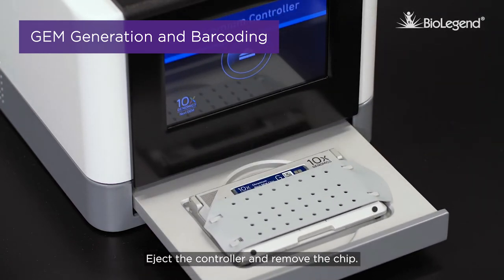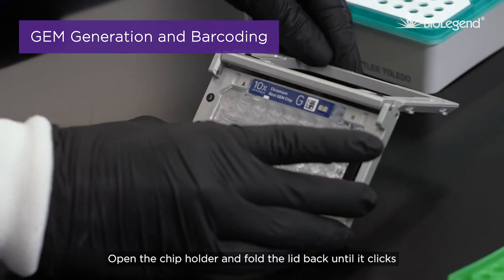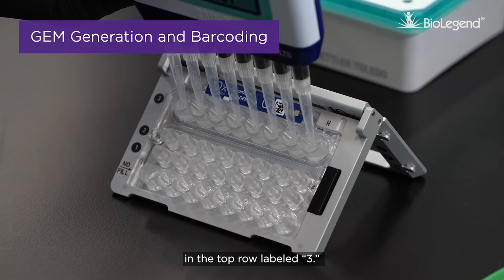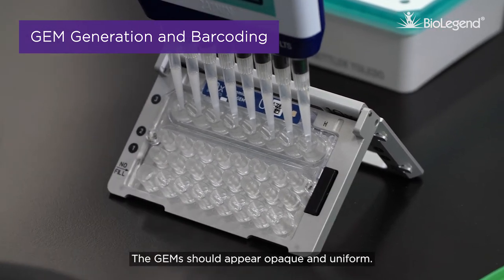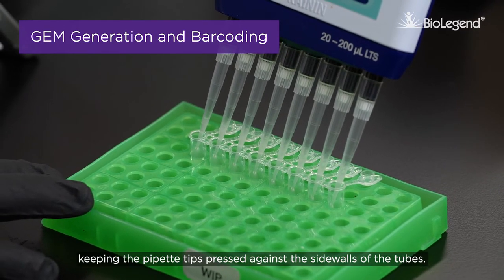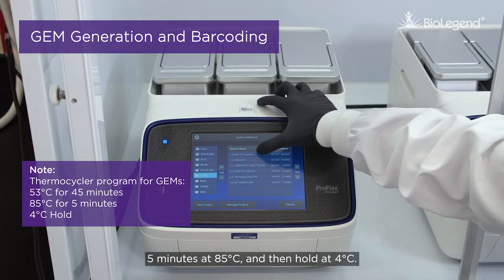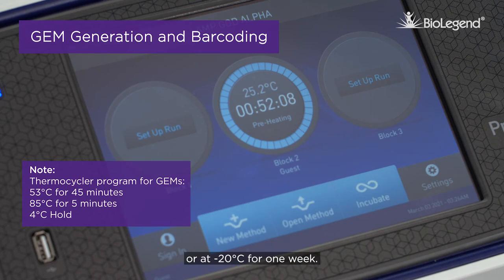Eject the controller and remove the chip. Discard the gasket. Open the chip holder and fold the lid back until it clicks to expose the wells at 45 degrees. Slowly aspirate 100 microliters of GEMs from the lower points of recovery wells in the top row labeled 3, without creating a seal between the tip and the bottom of the well. Withdraw the tip from the well — the GEMs should appear opaque and uniform. Over the next 20 seconds, dispense the GEMs into a tube strip, keeping the pipette tips pressed against the side walls of the tubes. Incubate the GEMs in a thermal cycler for 45 minutes at 53 degrees Celsius, 5 minutes at 85 degrees Celsius, then hold at 4 degrees Celsius. You may store these at 4 degrees Celsius for 72 hours, or at negative 20 degrees Celsius for 1 week.